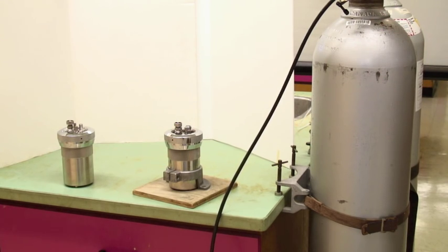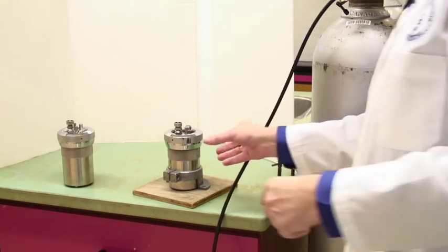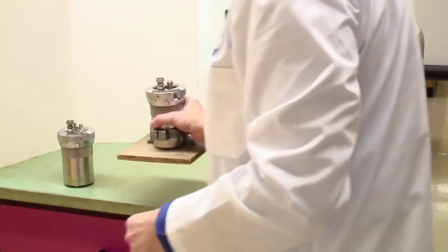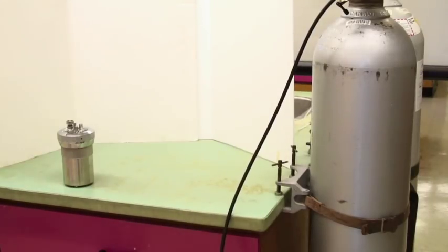We'll show you the other kind later, the second kind of charging. It's not very different. So we pick this up and go over to the calorimeter now.